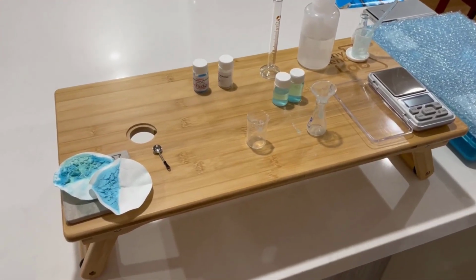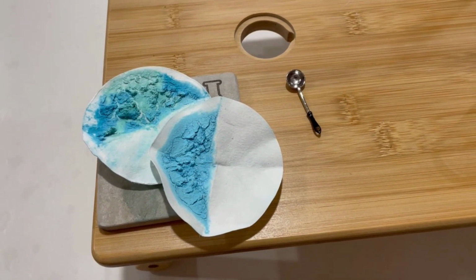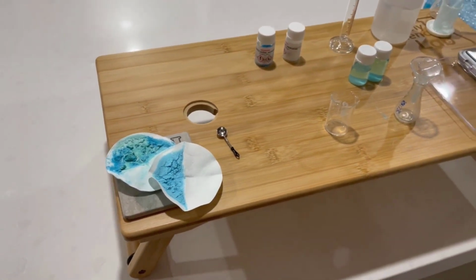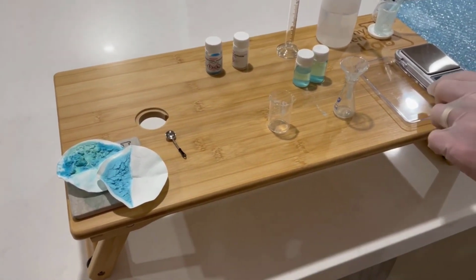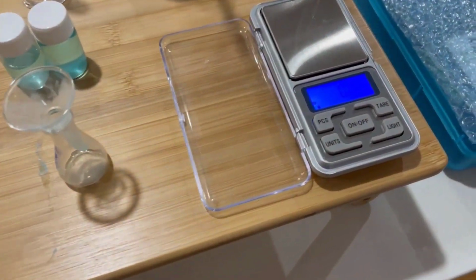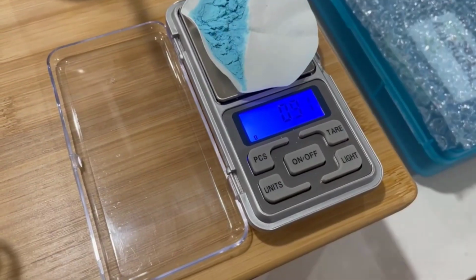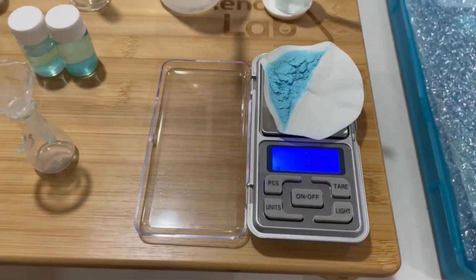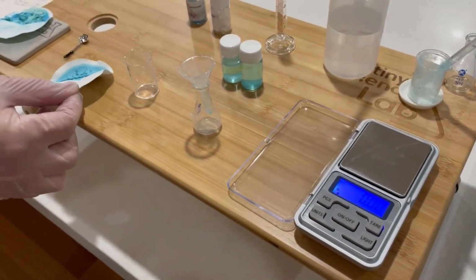So we've let these settle for a little while. We've actually had to bring them inside because it's been such a windy day that we didn't want any of the precipitate to blow away, which would be a very important source of error. So what we're going to do is turn on our little electronic balance over here. So I'll put on the first. So here's the first one, 0.91. You can see that the precipitate doesn't look anywhere near as impressive now that it's dried out.